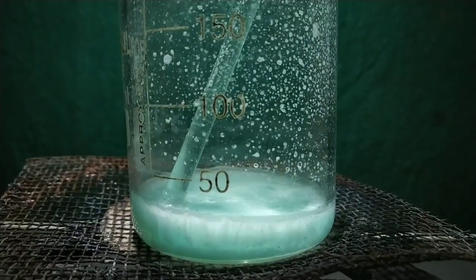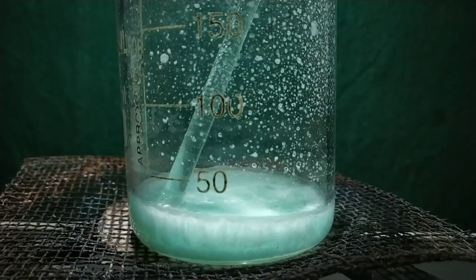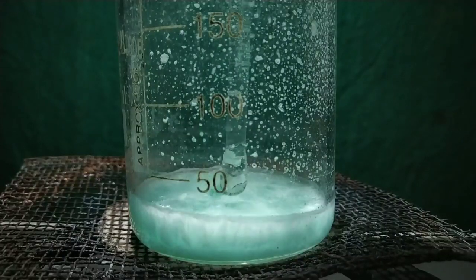After boiling it down to 25 ml, I cooled the solution and you can see the crystals of silver nitrate formed.